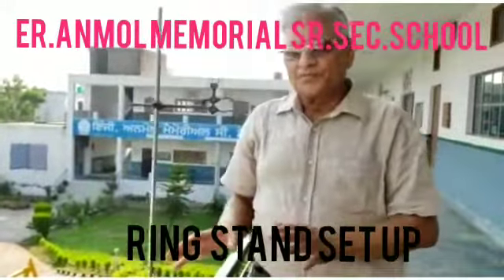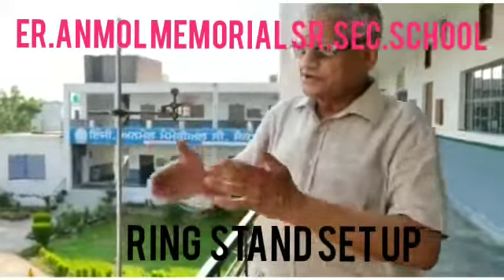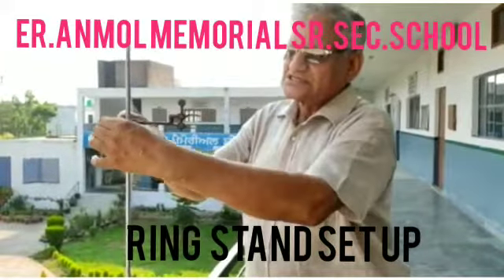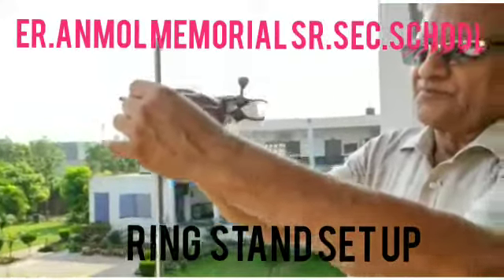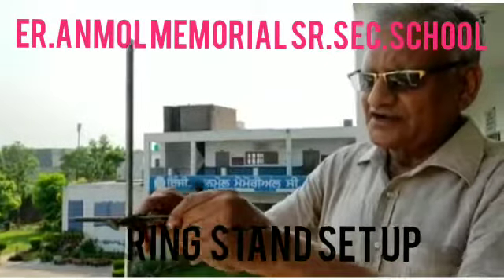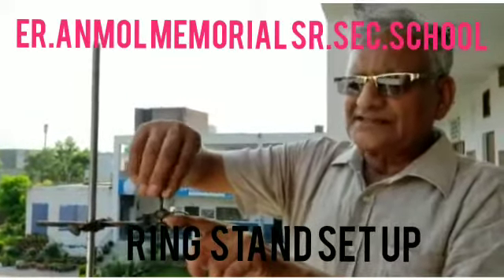So this is how you can adjust the stand and its parts. I have seen most of the students — they cannot adjust it. Again I am telling you: this is the screw where you can turn it upwards and downwards. This is the second screw — on the other side you can bring it forward and backward. There is a third screw which by turning clockwise you can decrease the space and make things tighter.